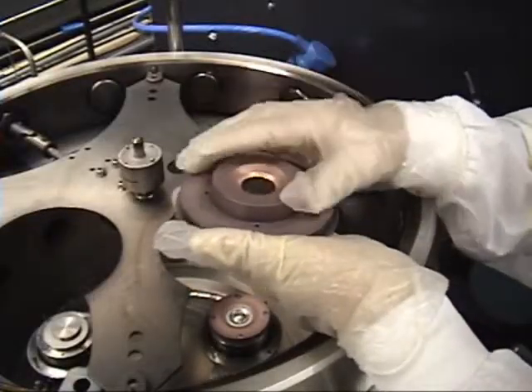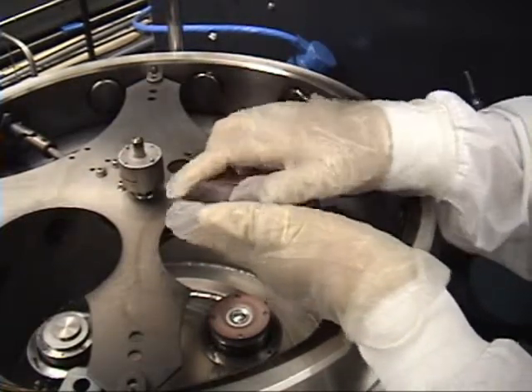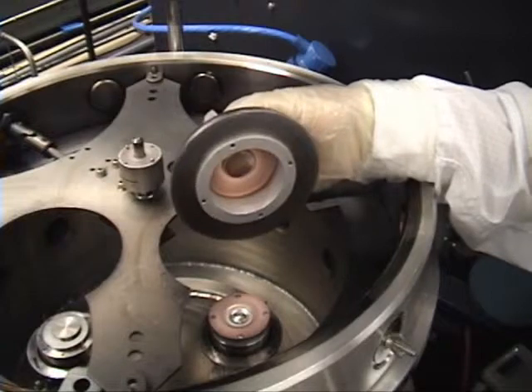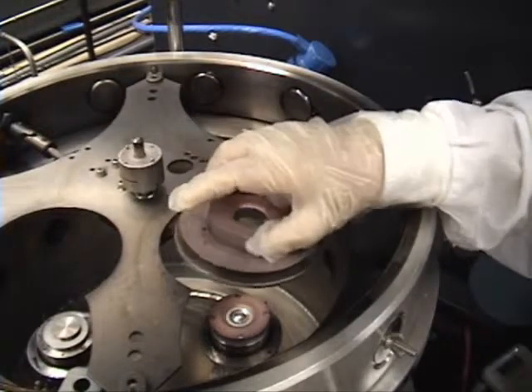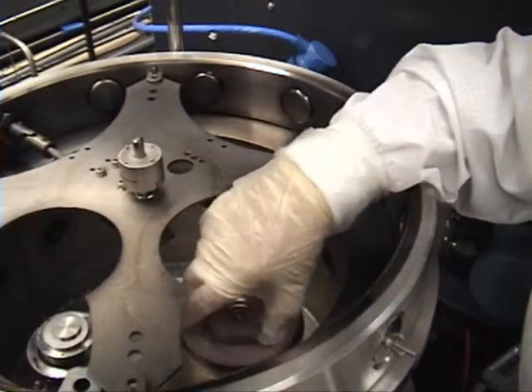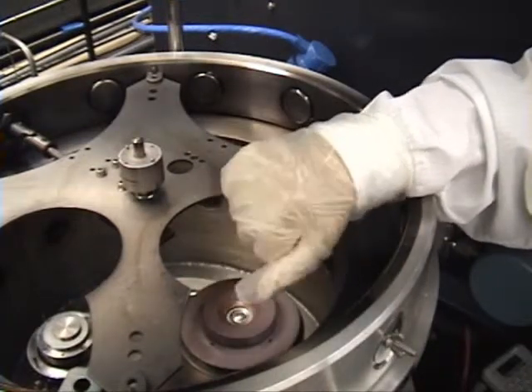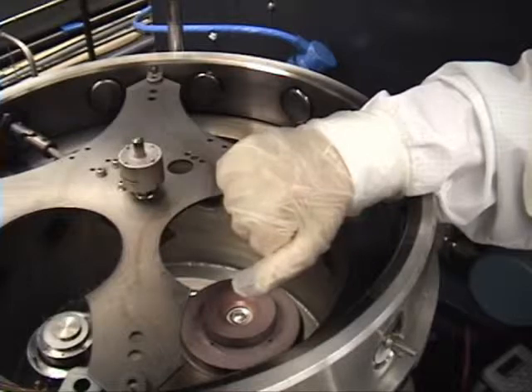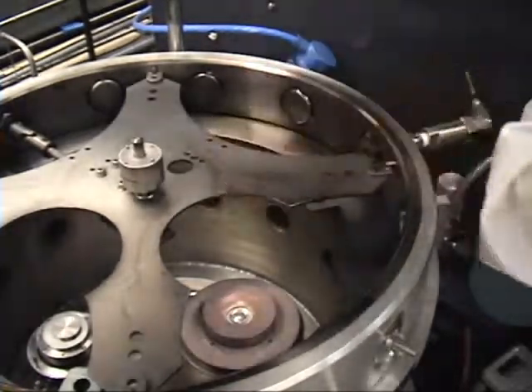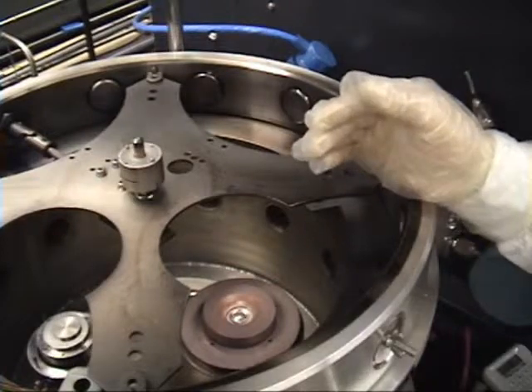Your anode has two pieces, so you always want to hold it from the center or the center piece will fall. You have four holes and you want to make sure that they align on both pieces. Then you're going to drop the anode onto three pins — any of the four holes on the anode, it doesn't matter which hole, you drop them into the three pins. If one pin was to break, you can still run this machine with two pins. Now we have the anode and we're going to check the status box to make sure the LED is green and okay to continue.